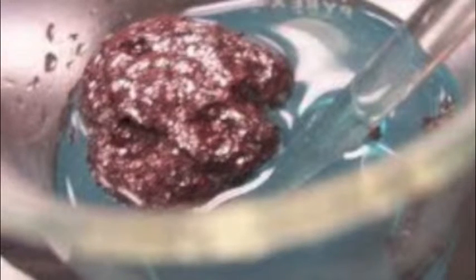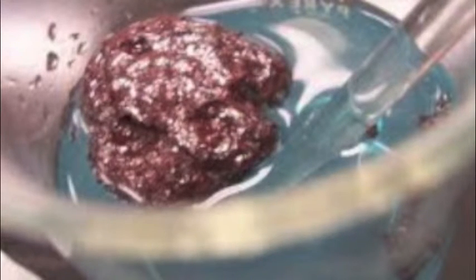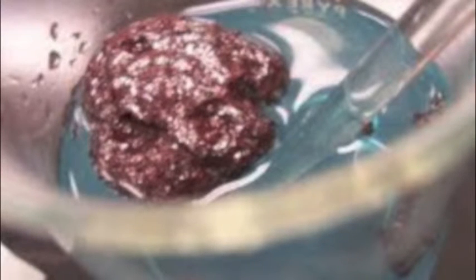In a lab experiment, we put aluminum into a copper chloride with water solution. As we let it sit there, the aluminum began to get replaced by the copper. This is an example of a single replacement reaction. Notice the red on the aluminum. The red on the aluminum is now copper.